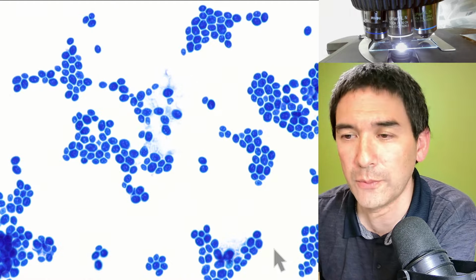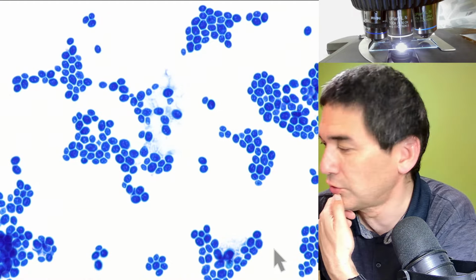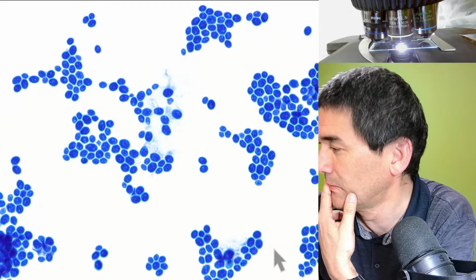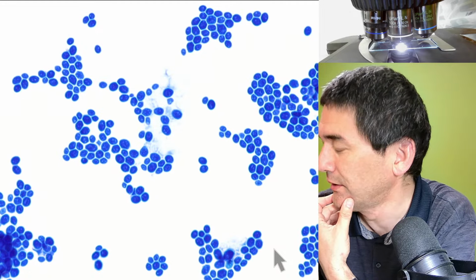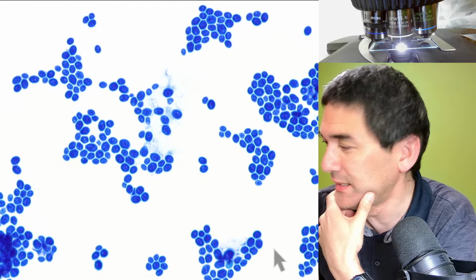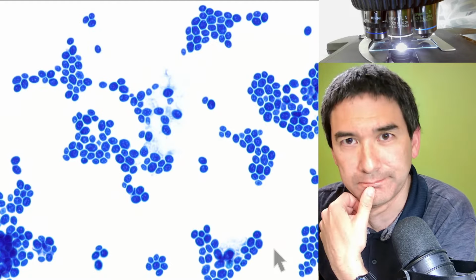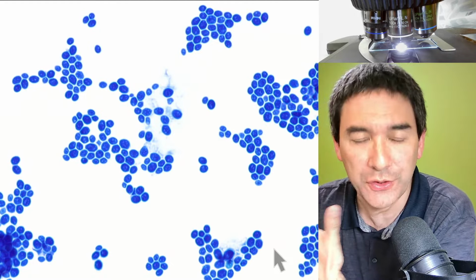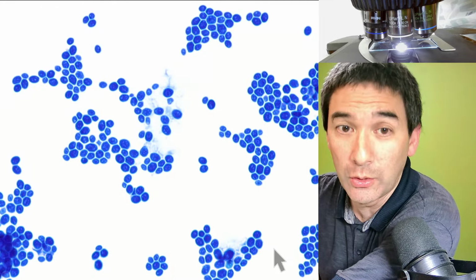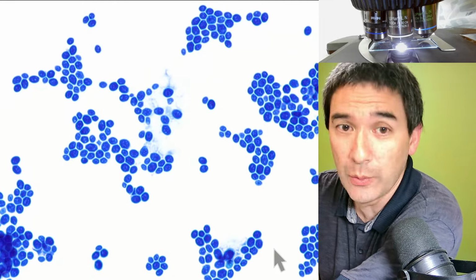There's a very brief question: can I now try this with a cover glass? What I could do is the following. Why not, I'm going to try this. There is no oil on here. Okay, I'm going to stay with oil. I'm going to lower this because somebody was just asking, and I have to do this now.